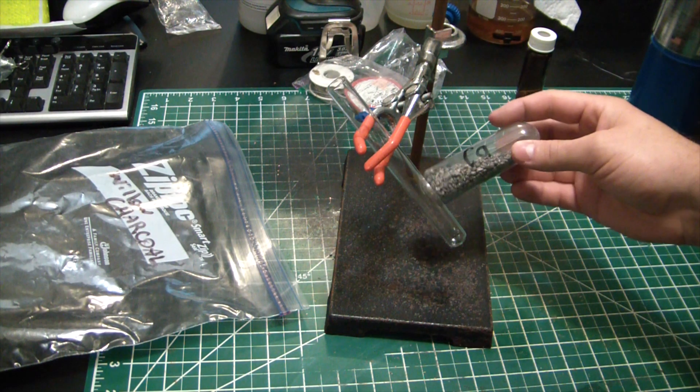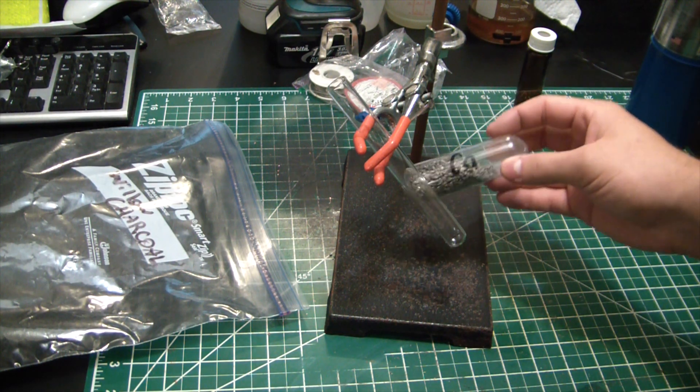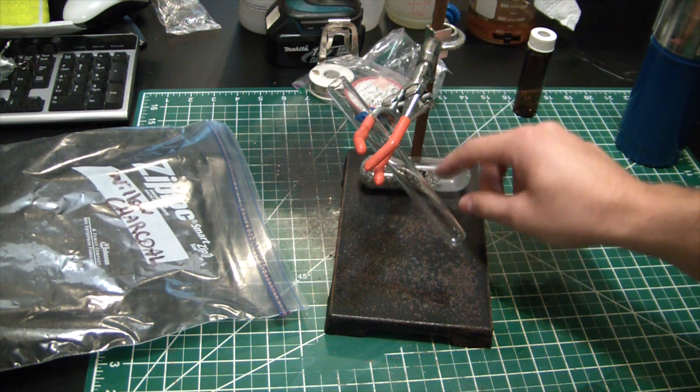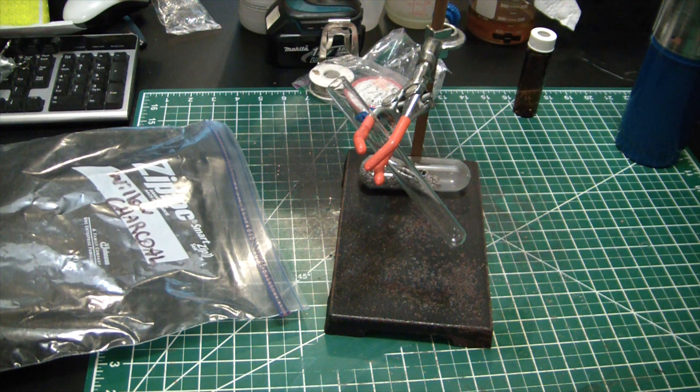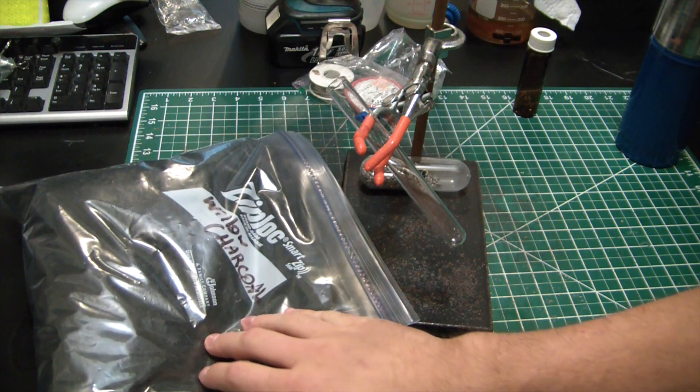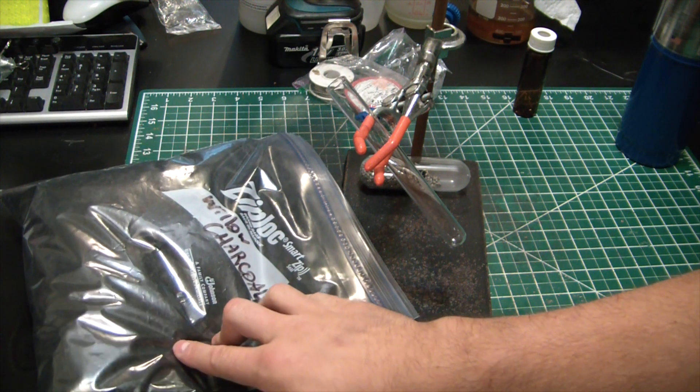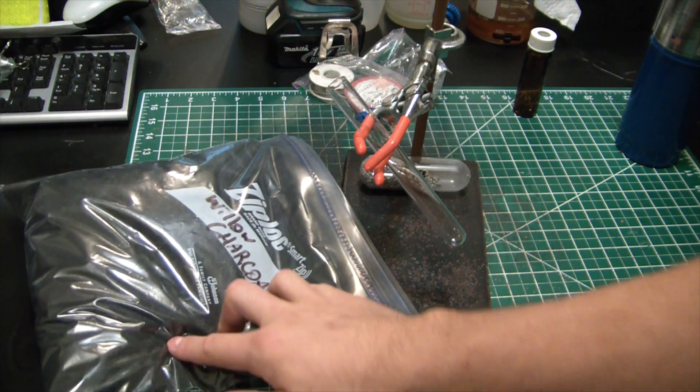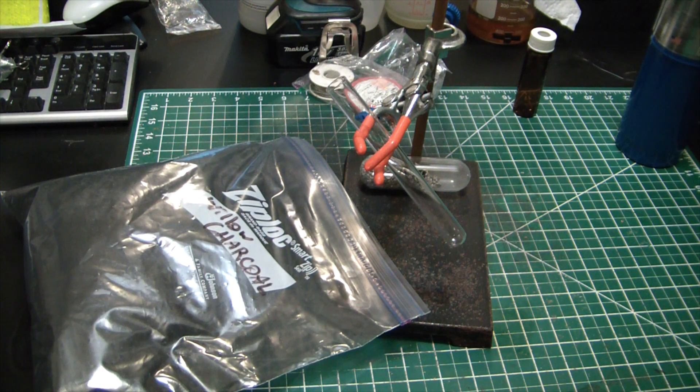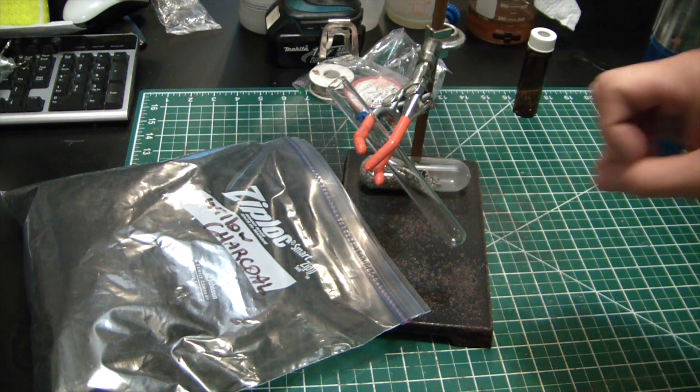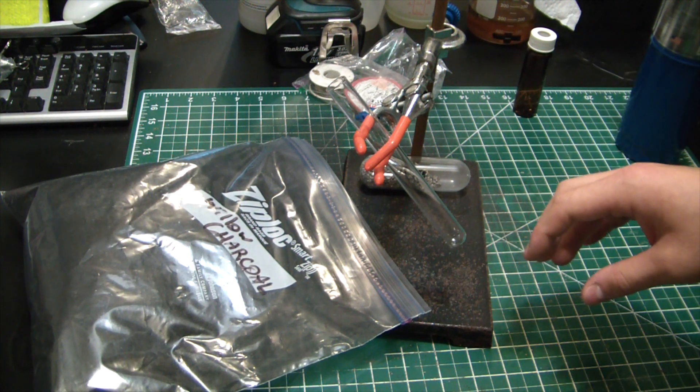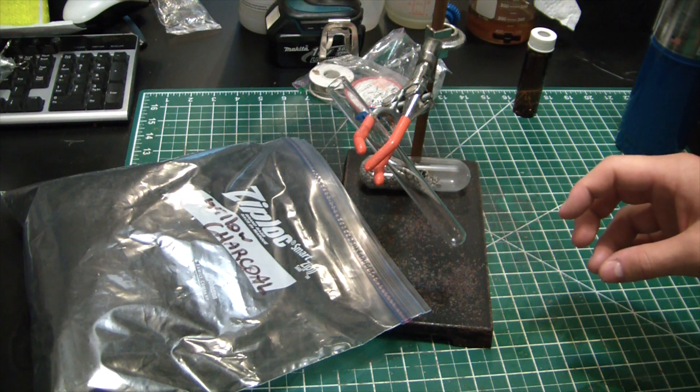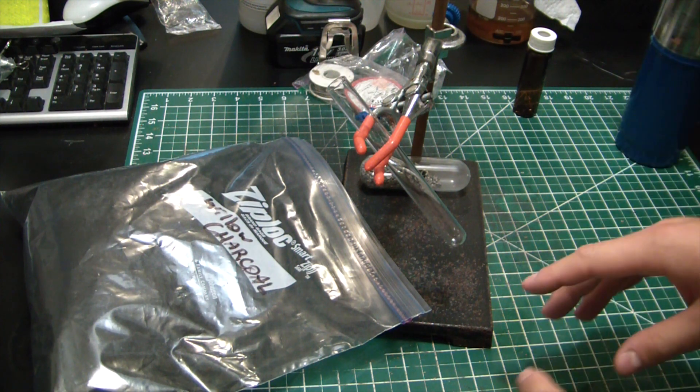I'm actually going to be distilling some cesium and figured this would be a good reducer for the cesium chloride. Got some willow charcoal that we made in a previous video - that's going to be our carbon source. We're going to slap them in here, react them together under some major heat, and hopefully get calcium carbide.